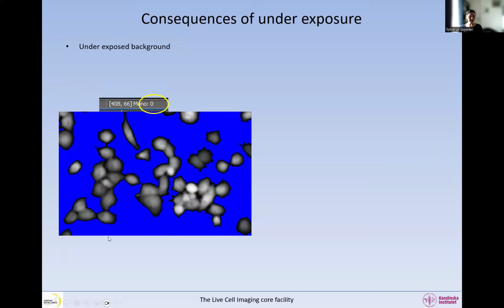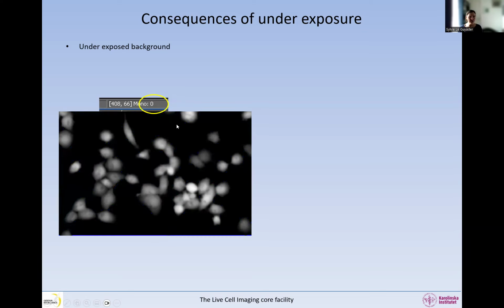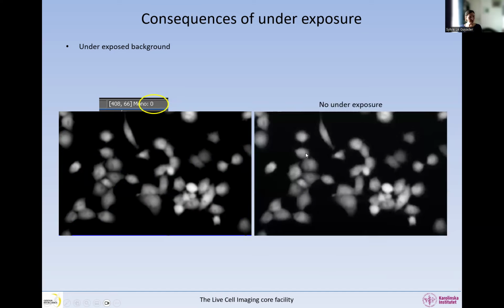So all the background pixels are set as 0. This is clearly an image that is acquired on a single point confocal with an offset at the wrong place. Okay, when we remove the lookup table that shows the undersaturated pixel, the image looks normal. So it's very difficult to see that there is a problem. However, here I have the same image that is now acquired without underexposure, and they look very much the same.